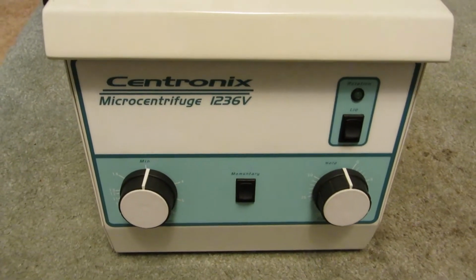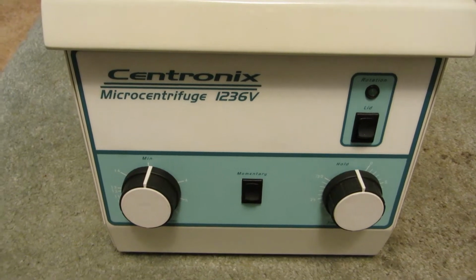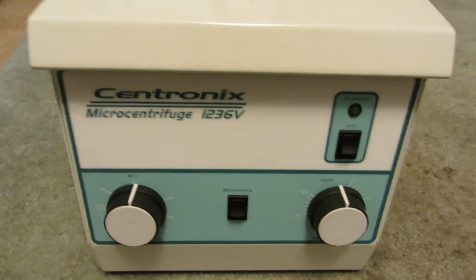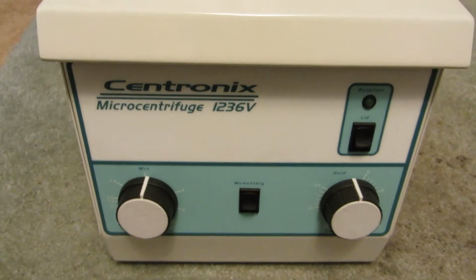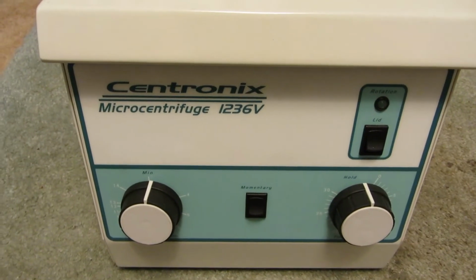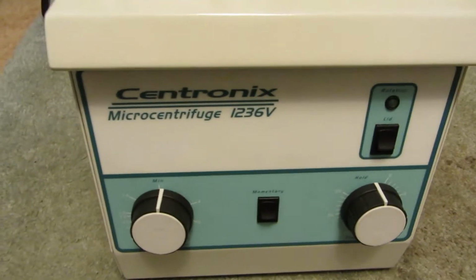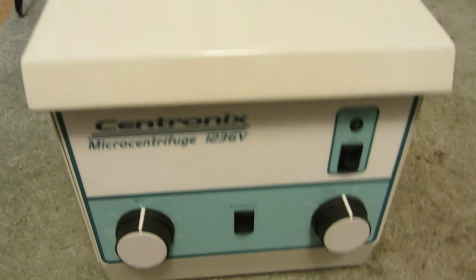Hey viewers, when's the last time you ever got to see inside of a centrifuge? Probably never, just like me. Until now, I got a hold of this little one, Centronix Microcentrifuge 1236V. It's 120 volt.